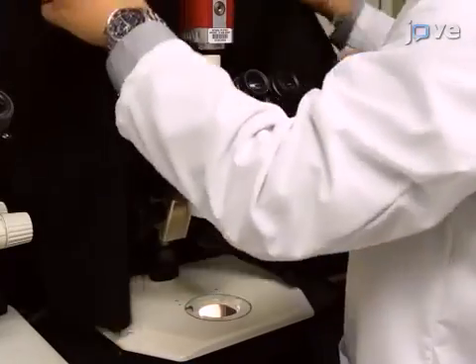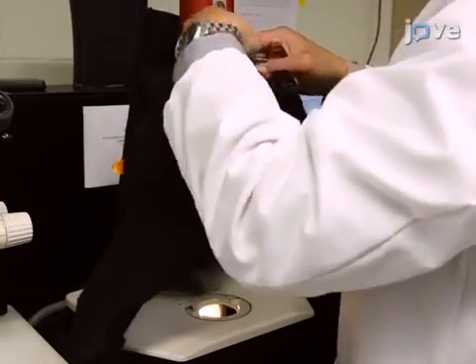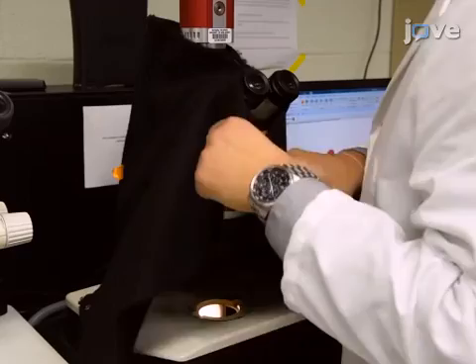Cover the microscope with a dark cloth to prevent glare in the swim drop area on the microscope slide and improve image quality.